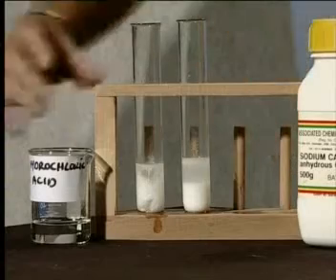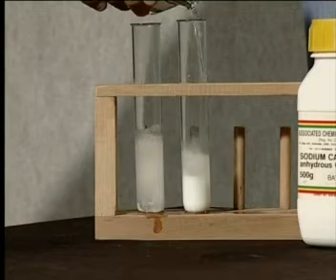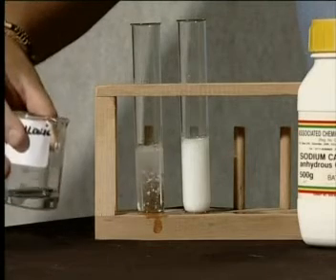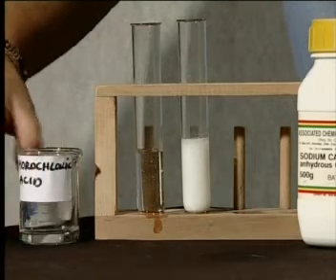The next part of the test is to add acid to both solutions. In this case, we will add hydrochloric acid. Can you predict what will happen next? Can you see that the white precipitate remains when the acid is added to the barium sulfate? The white precipitate of barium carbonate dissolves and bubbles of gas are released. So now can you see that we have a positive test which will help us identify the presence of the sulfate anion.